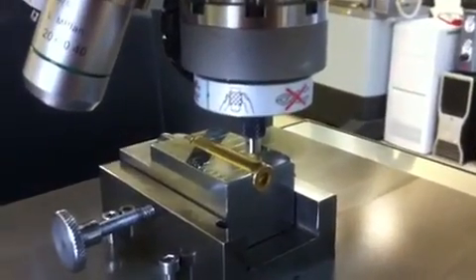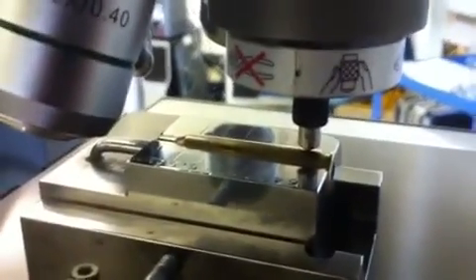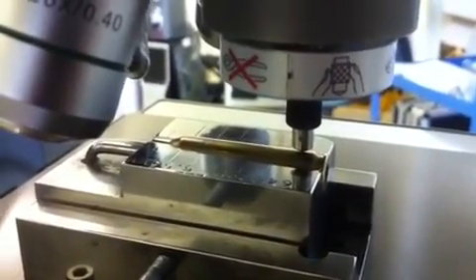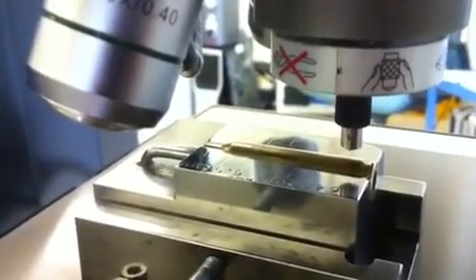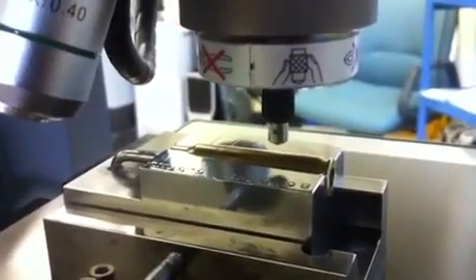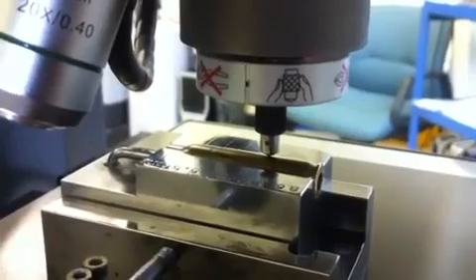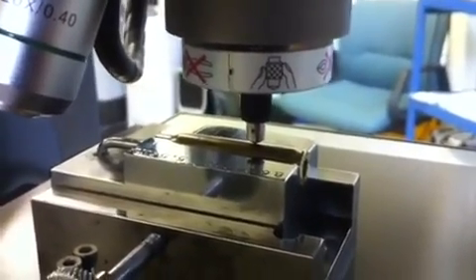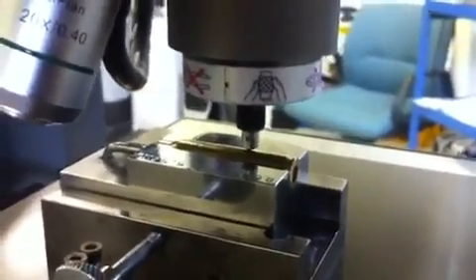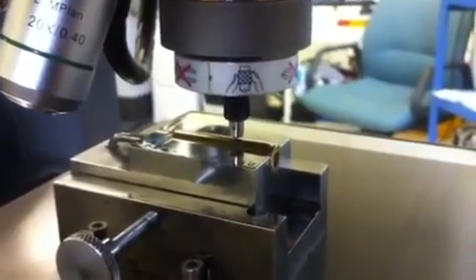At this point on, the software is completely taking control, and our tester will now make a series of indentations along the bullet shell. What I've programmed in here, for this particular application, is 4 indentations on the larger OD of the bullet shell, and then a final indentation on the necking end of the shell. You can see the system is now quickly moving over to each location. I've set the dwell time to comply to the ASTM and ISO standards, so it's set to 10 seconds. The dwell time is variable, though; we can change it to whatever the user may desire.